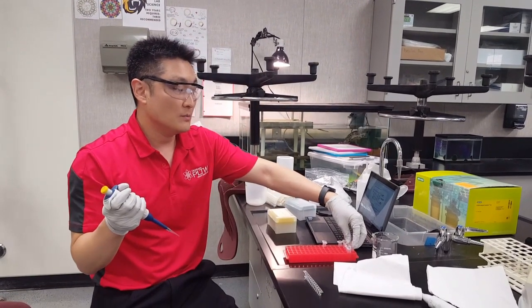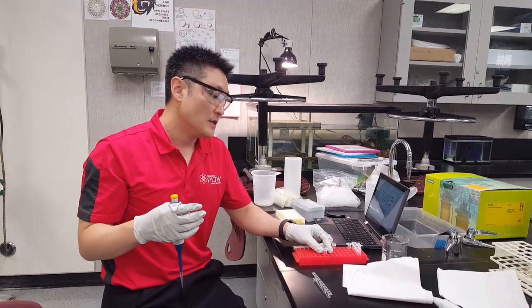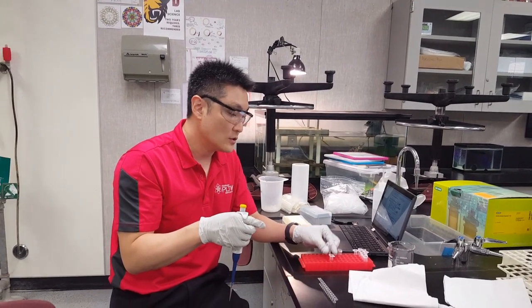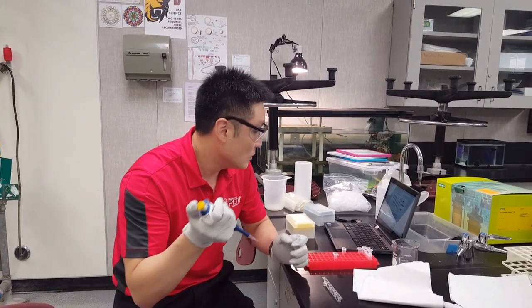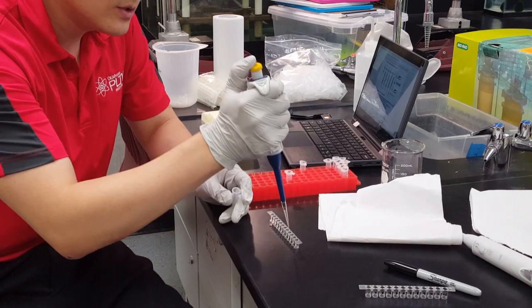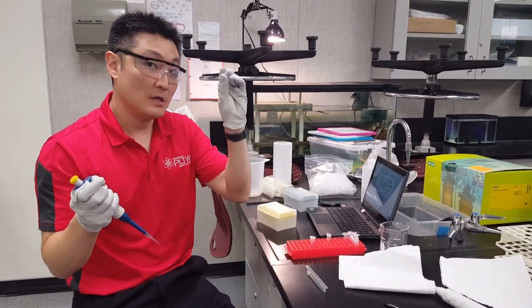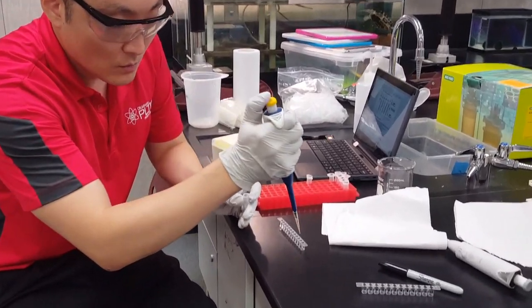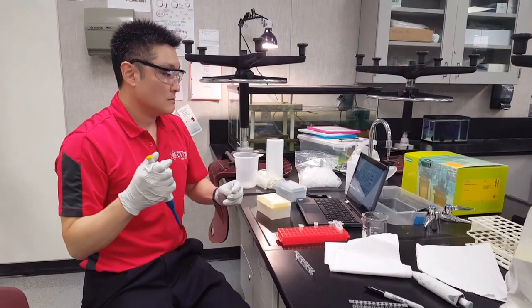Now add your patient samples. Some of you might have patient 1 and 2, others might have different patient numbers — the patients represent Sue and her friends. Get your first patient sample (e.g., patient 1) and pipette 50 microliters each into wells 19, 20, and 21. Change the tip, then add 50 microliters of your second patient sample into wells 22, 23, and 24. Change tips when done.